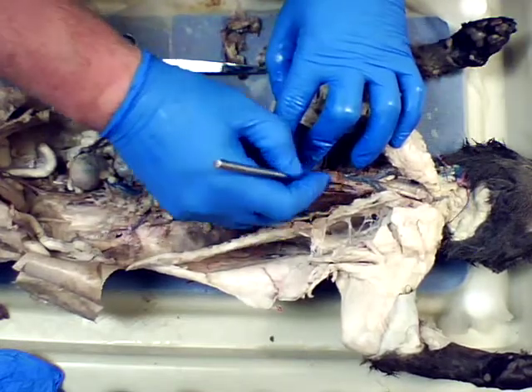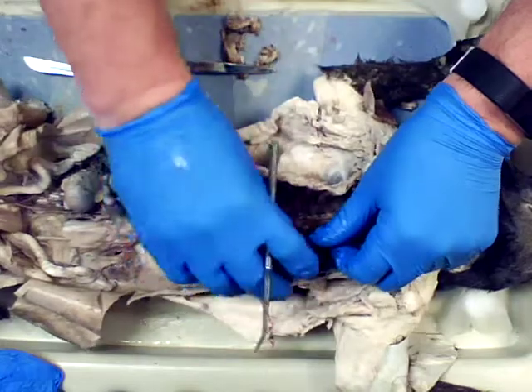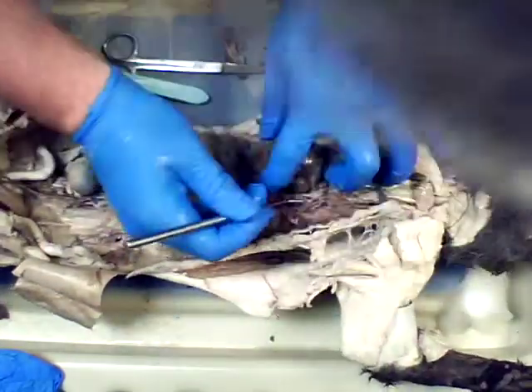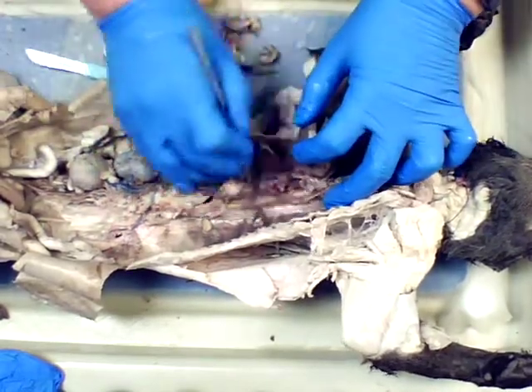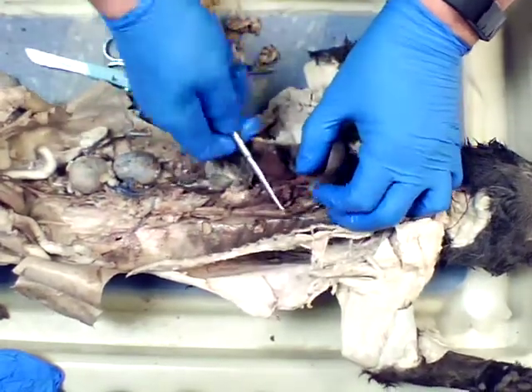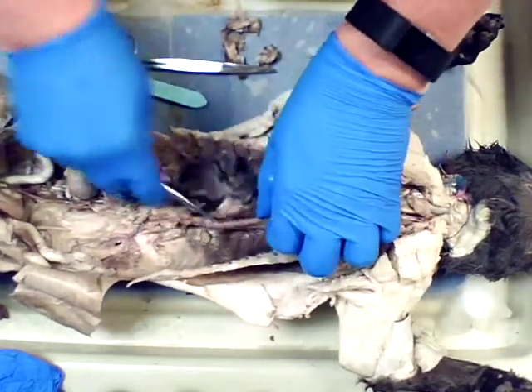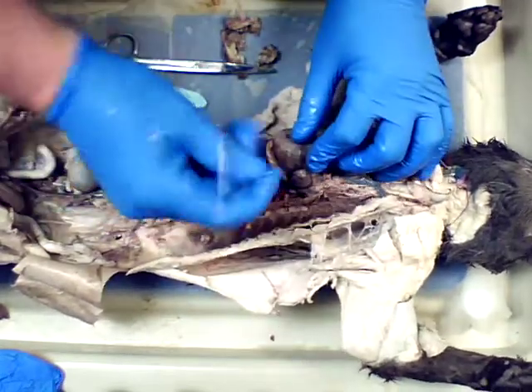So if I am good enough in here, I can find the aortic arch in all this material. Sure I can. All right. So here we go. There's the descending aorta right there. So right here is the descending aorta. So I'll use that as a guide. So that's going down. I'm disconnecting that. So there's my descending aorta. Okay, so it's coming in here.